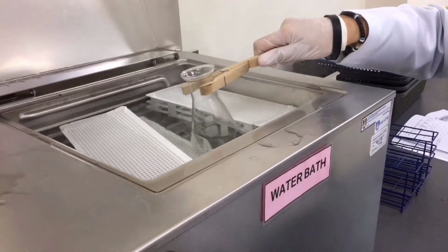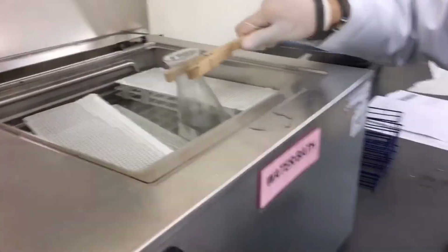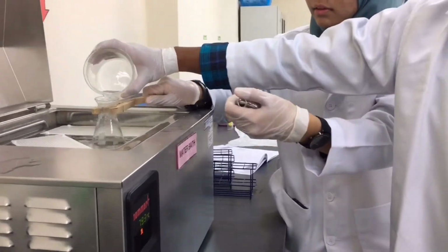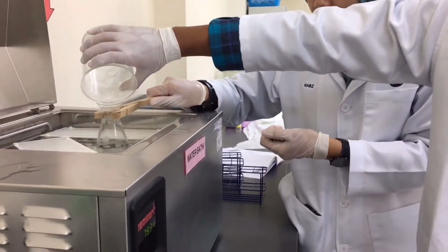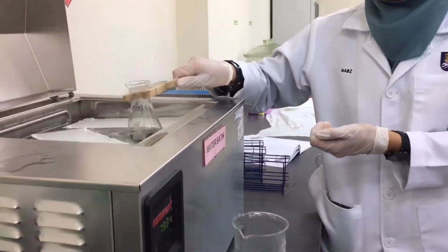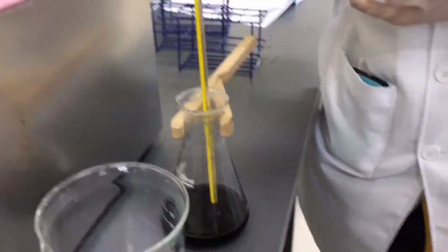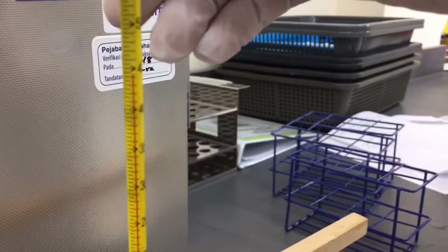Now, the third part of the experiment, which is at hot temperature, the mixture was warmed in a water bath for 5 minutes. Then, the timing began as soon as the sodium peroxydisulfate is added and the reaction is immediately swirled to ensure good mixing. When the solution turns blue, the timing was stopped and the temperature is recorded.